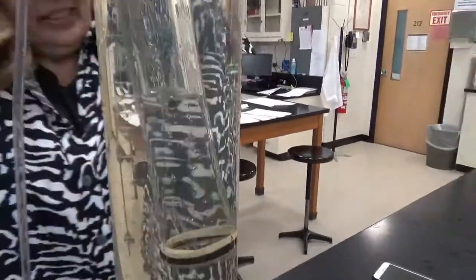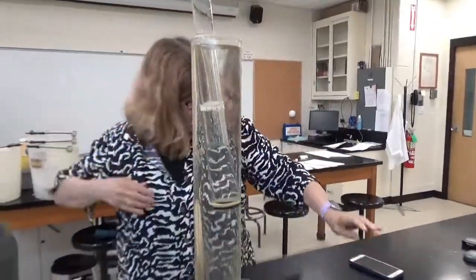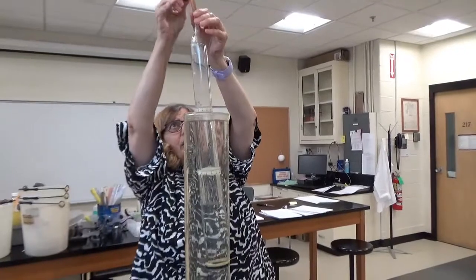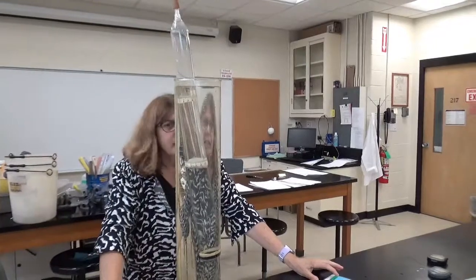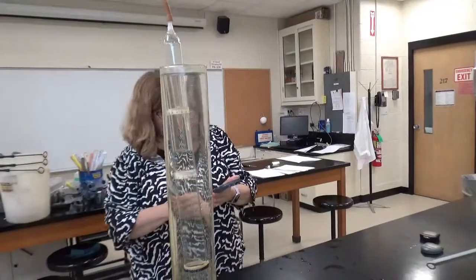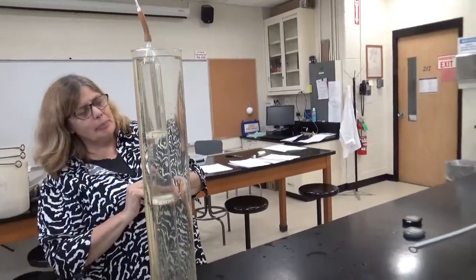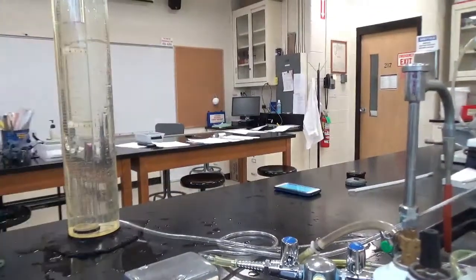And you can see that the level is below where the numbers are. So we're going to take the tube out. Get my cell phone ready. I'm going to take this out, and I'll say start when the level hits the bottom of the tape. Start. Stop. What'd you get? 12.24. I got 12.33. Oh, we're good.